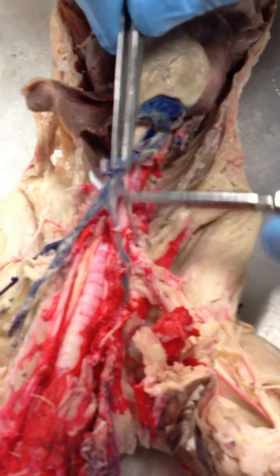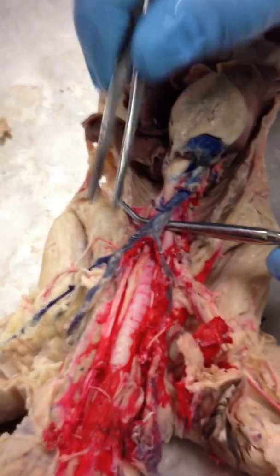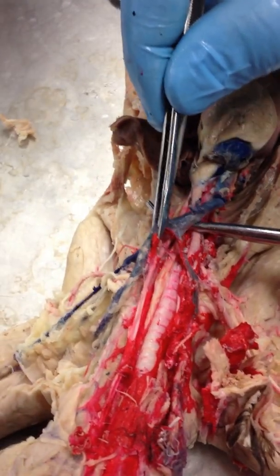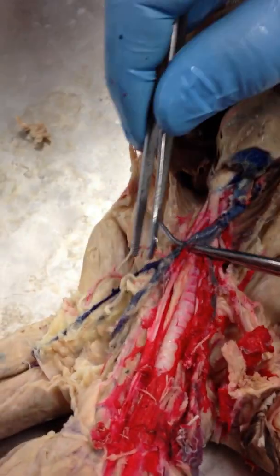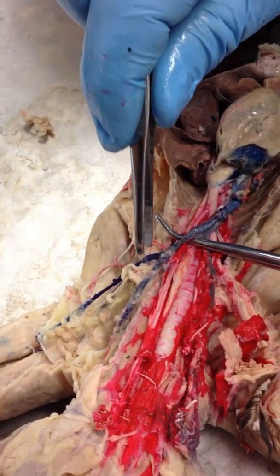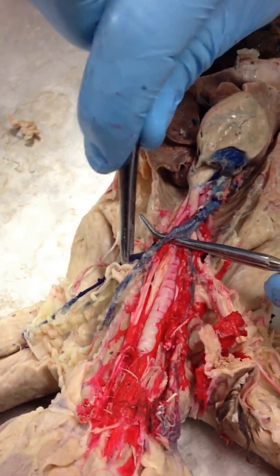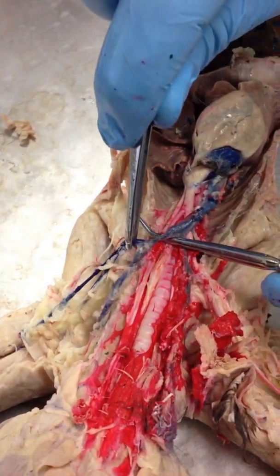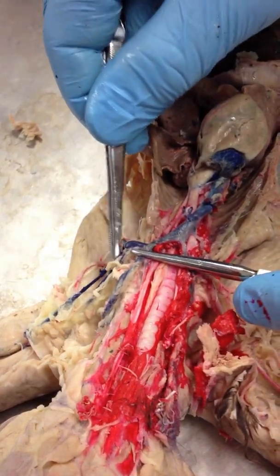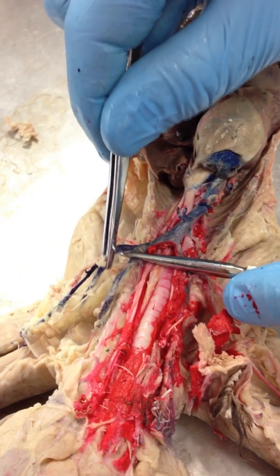The pre-cava is going to branch into the left brachiocephalic vein and right brachiocephalic vein. The brachiocephalic veins are going to branch into the left external jugular vein and left subclavian vein. The subclavian vein is going to branch into left axillary vein and left subscapular vein.